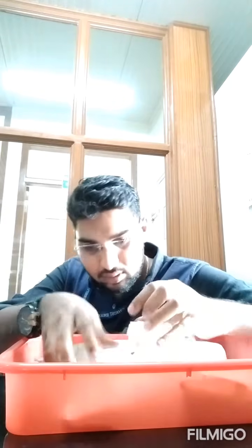So friends, we have kept this for incubation for 1 hour. Now the incubation is over. Immediately I am placing it over the ice pack. Here I have the ice pack kept in the trays to arrest the reaction, whatever has occurred so far, for some 3 to 4 minutes until it comes to room temperature. You can see here the tray is filled with ice. So I placed it here to arrest the reaction.